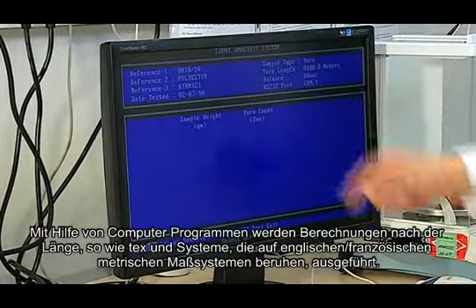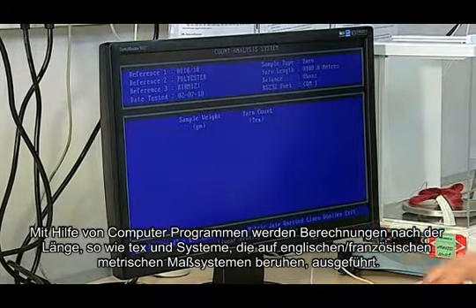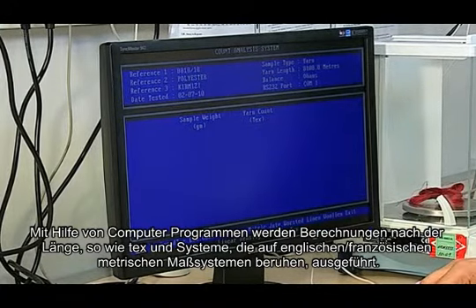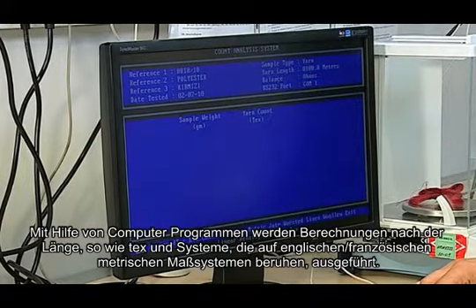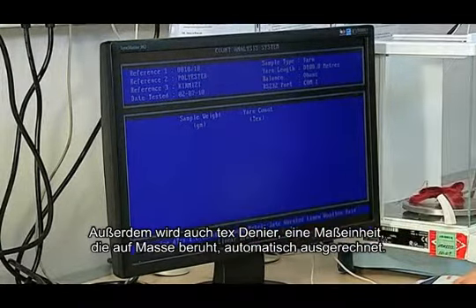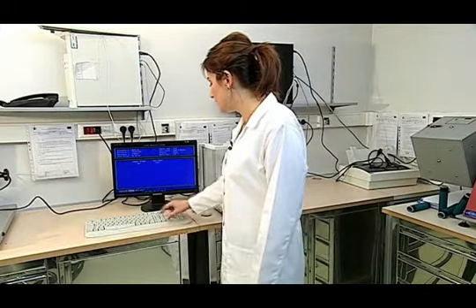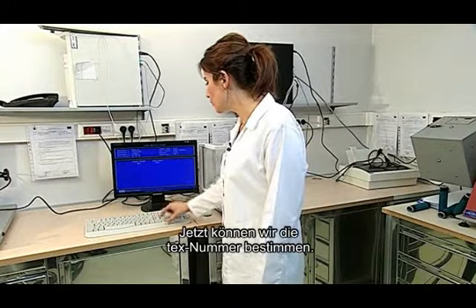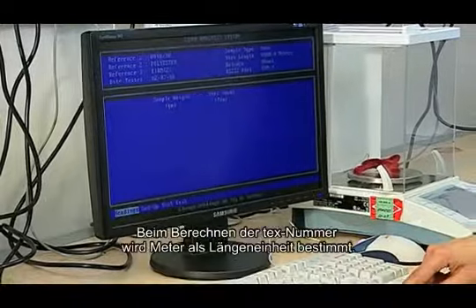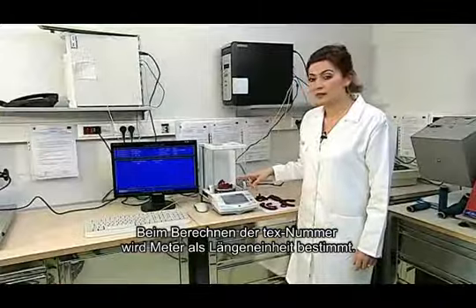With the help of computer programs, calculations according to length, such as tex, and English or French metric systems based on other numbers are done. Also, denier, which is a weight-based measurement, is automatically calculated. Now, we will find the tex number. The length unit is set as meters while finding the tex number.